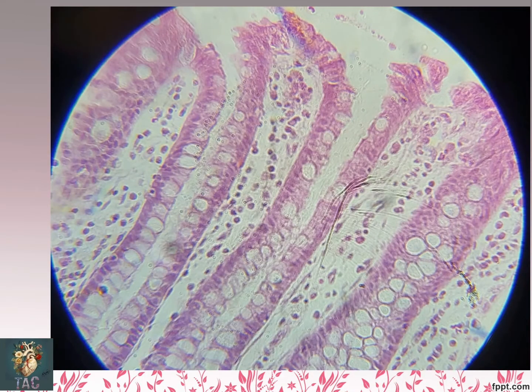This is another beautiful slide, and in this you can see this is the epithelium. This whole is epithelium, and this epithelium is a simple columnar again with a large number of goblet cells. You can see the mucus droplets which are present in the apical area of the goblet cells. You can notice the basally placed elongated nuclei of these cells. Also the goblet cells are present. So this is the simple columnar epithelium with goblet cells.